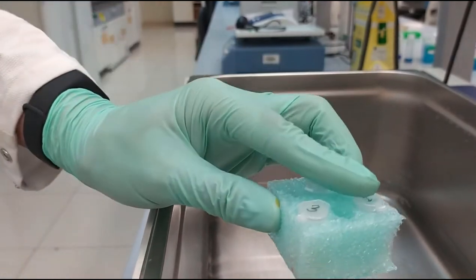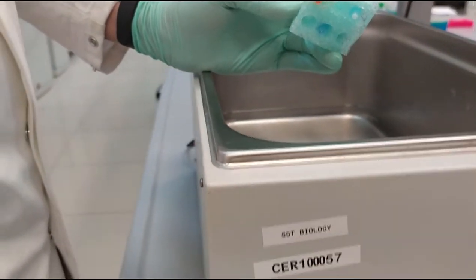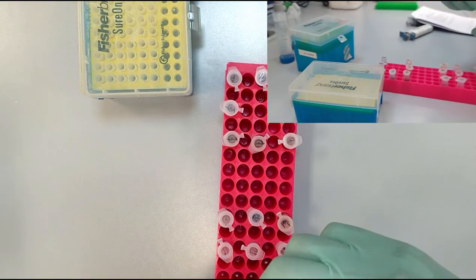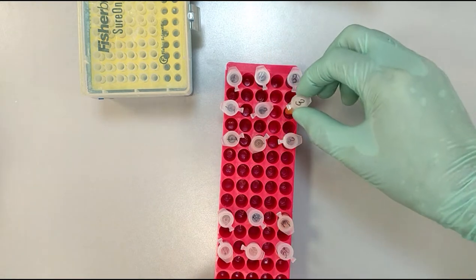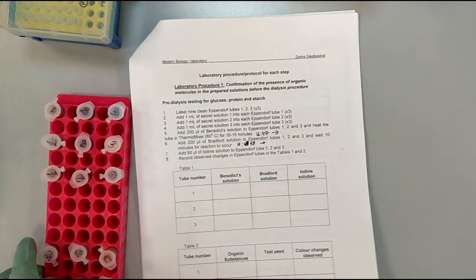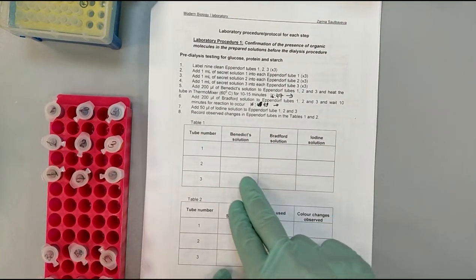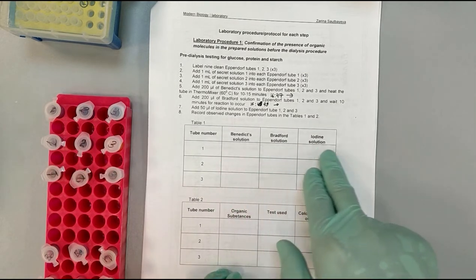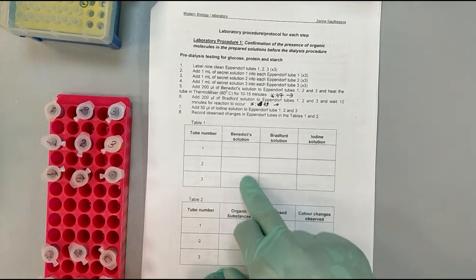Okay, now we go back to our bench with these results. Okay, now after we have performed all of the reactions, you need to write down the results of the reactions in each of the tubes with each of the reagents.